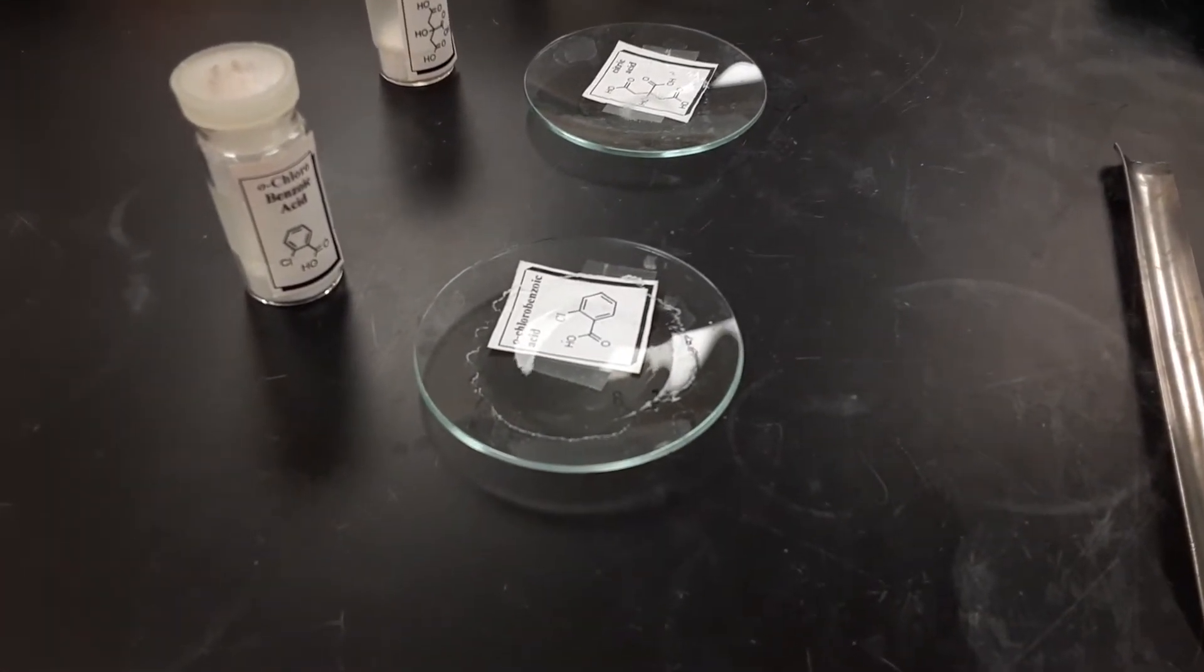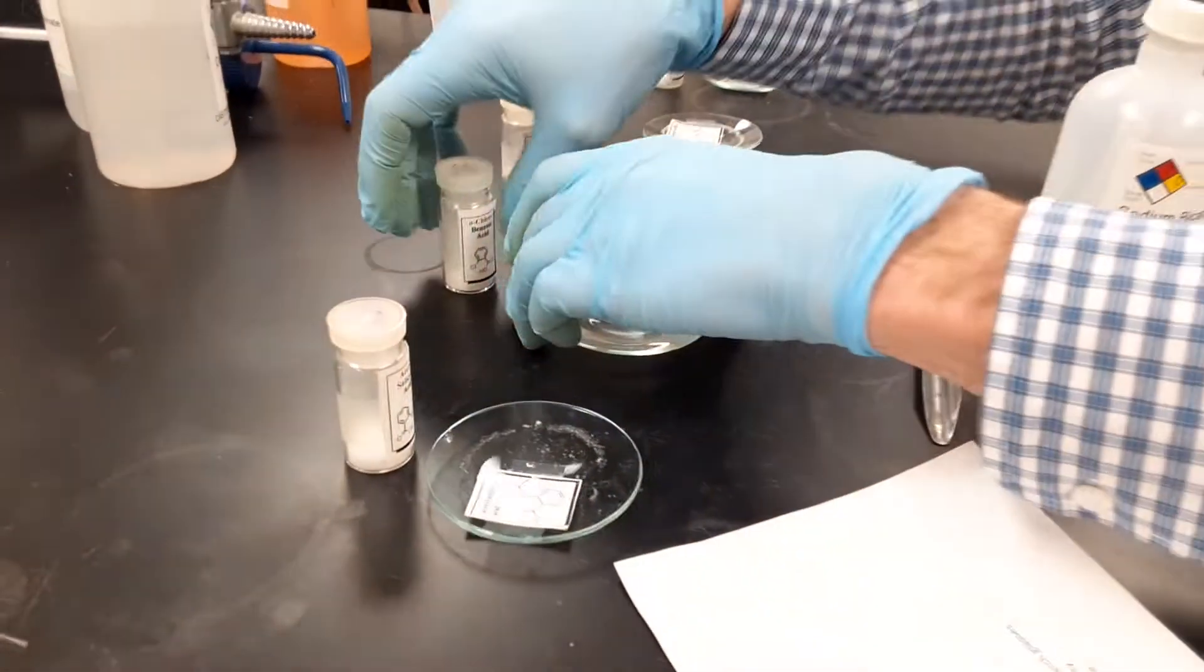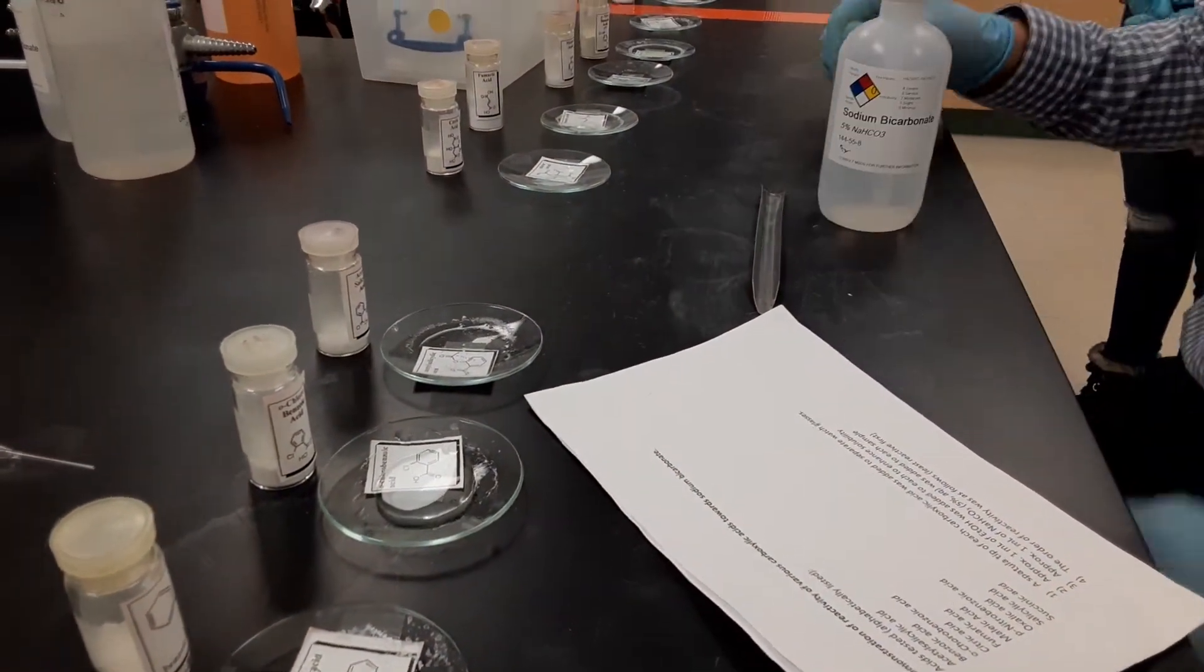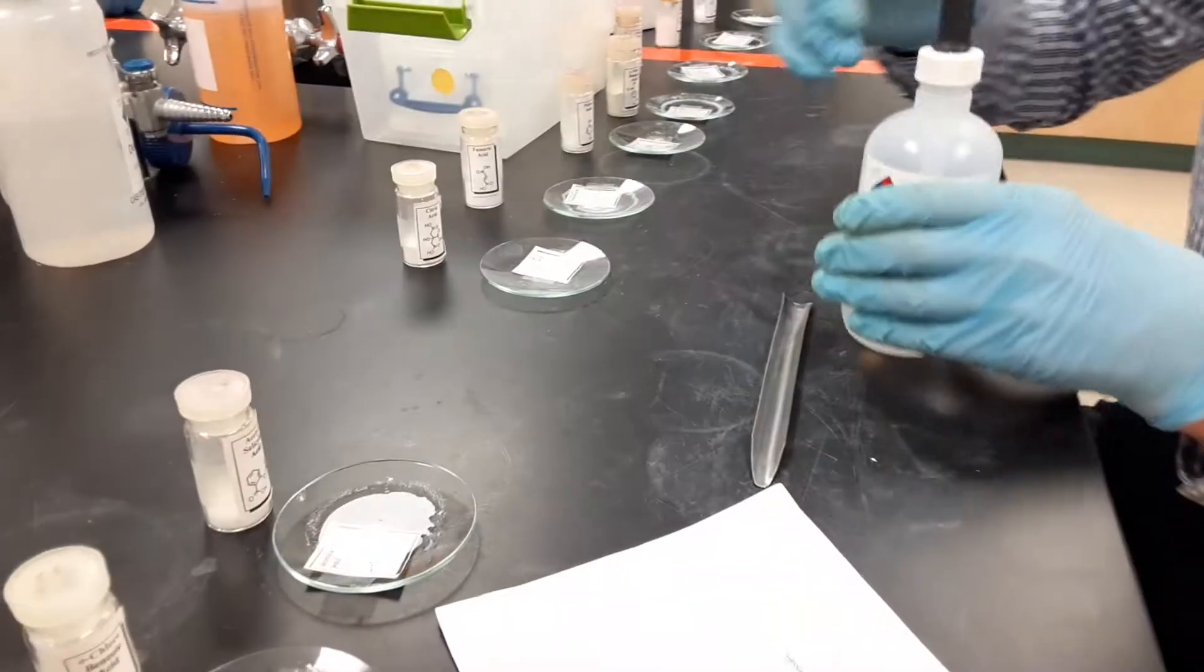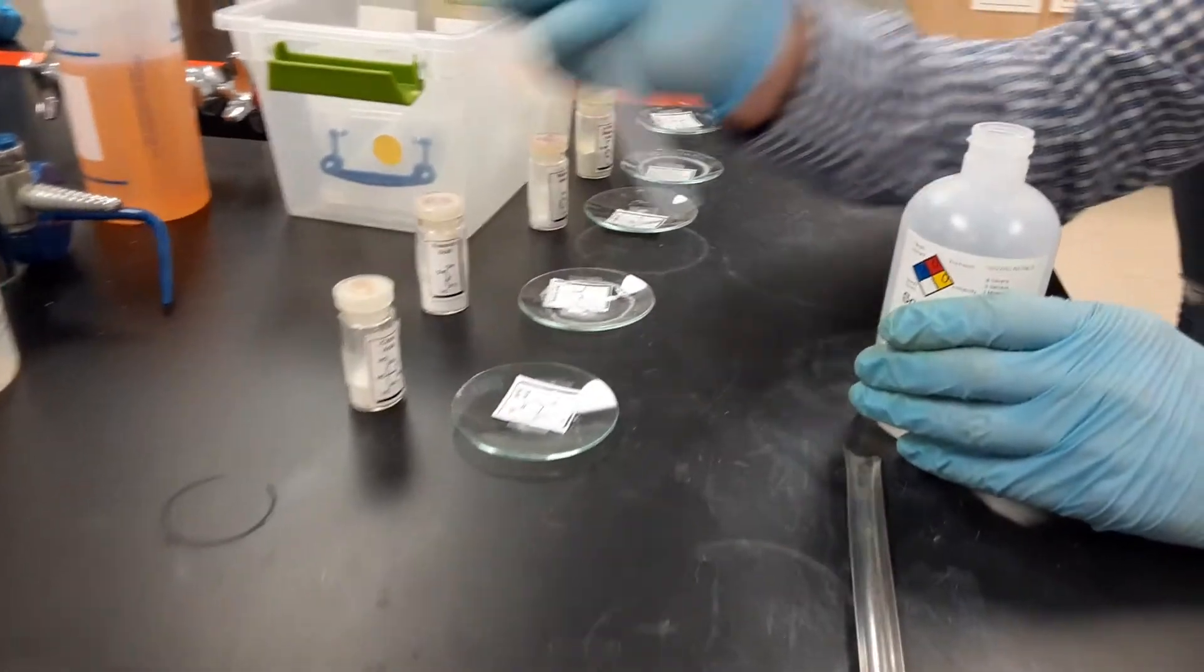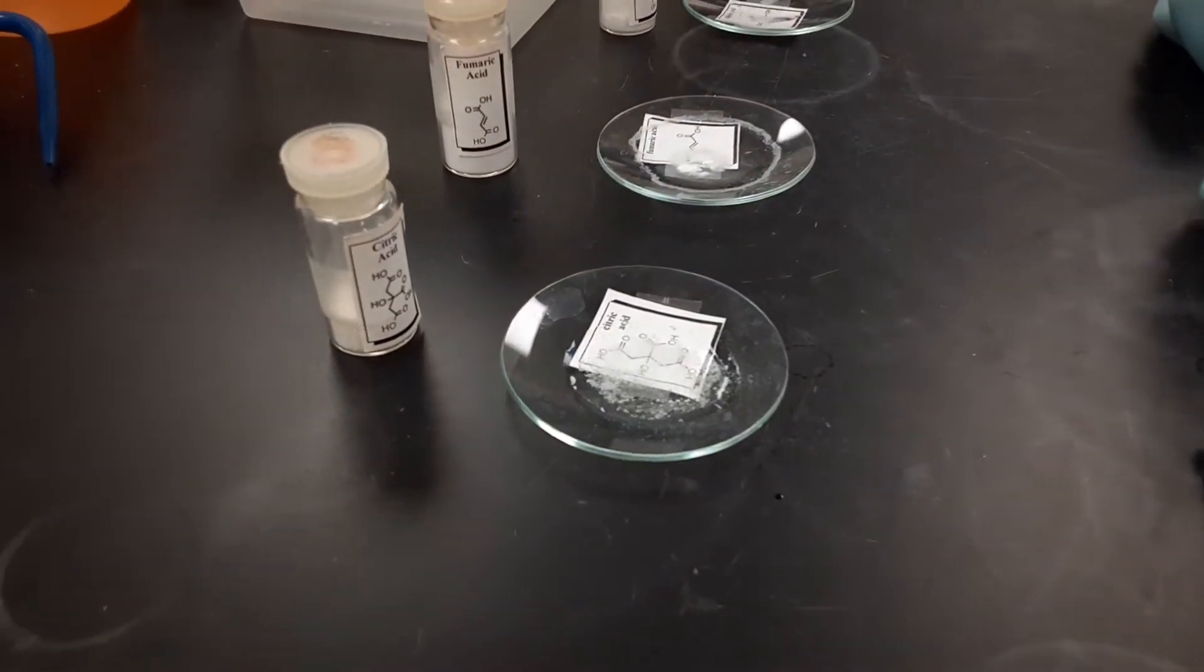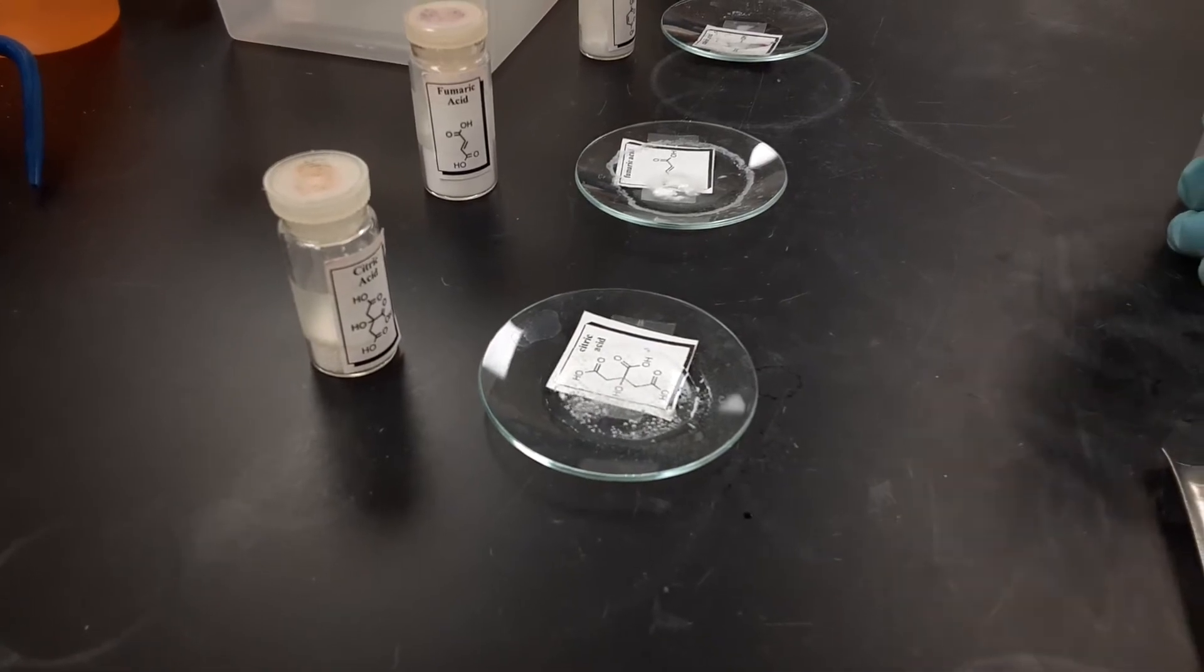It's not very fast, that's kind of like the first one. Citric acid, all right, now the fun begins. That's a real fast bubbler! Fumaric acid.